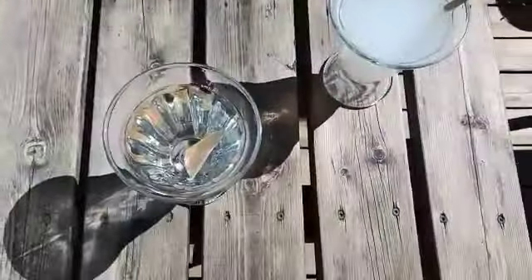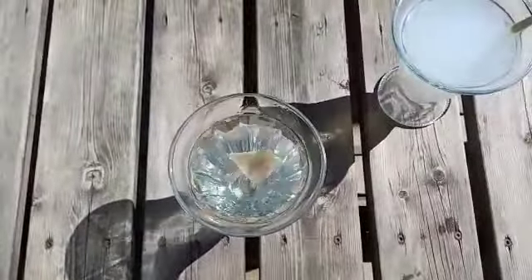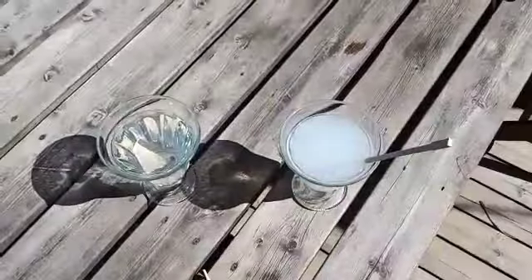I am doing the same with the glue from the Competitor and let's see what happens. It doesn't dissolve as easy as it should.